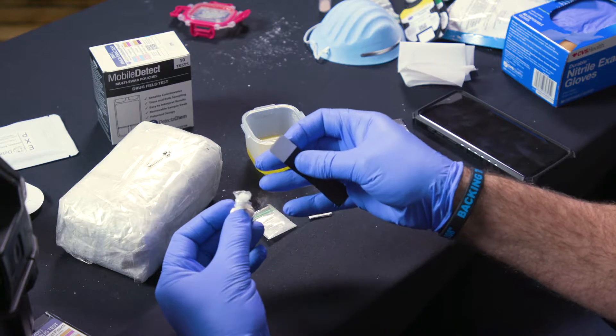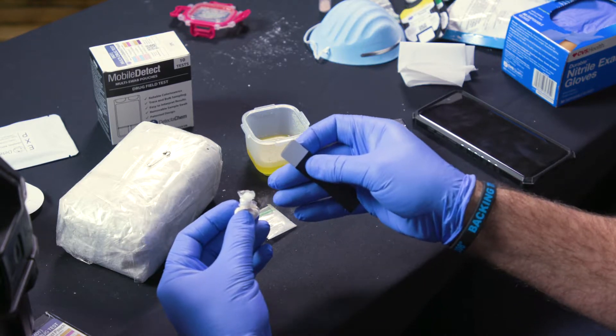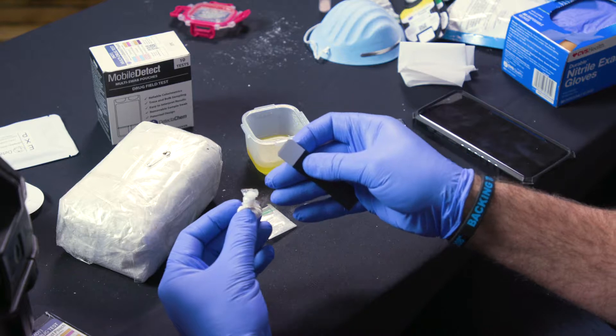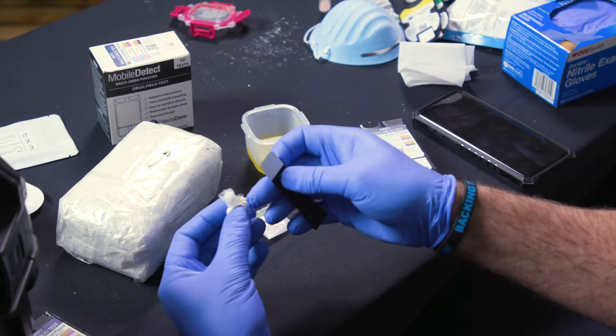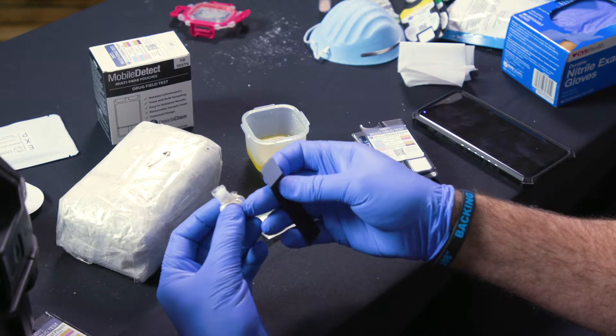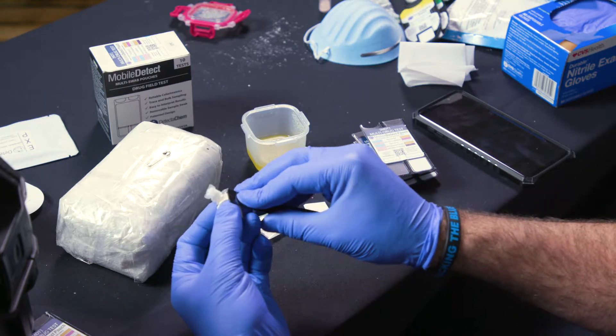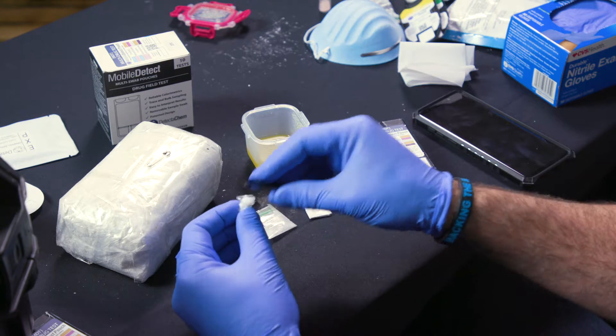If that doesn't work I don't want to guarantee that's gonna work every single time because there's variability depending on how good the bad guys are at packaging the material. So if that doesn't work you may need to make a slight tear and swab the inside material. But generally the top works well.